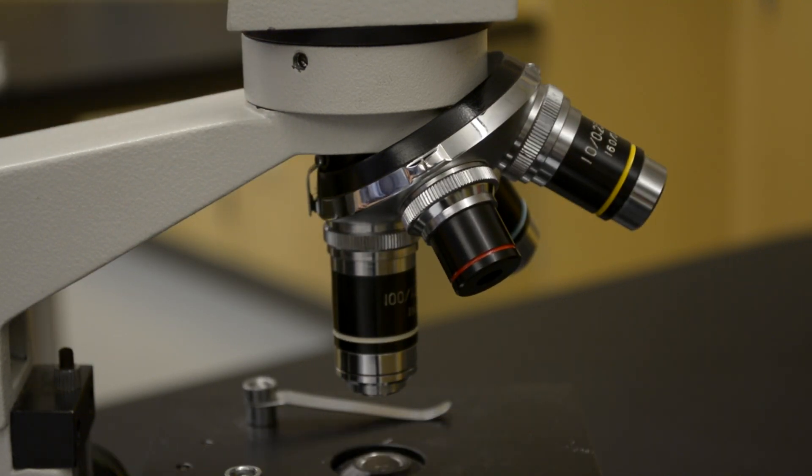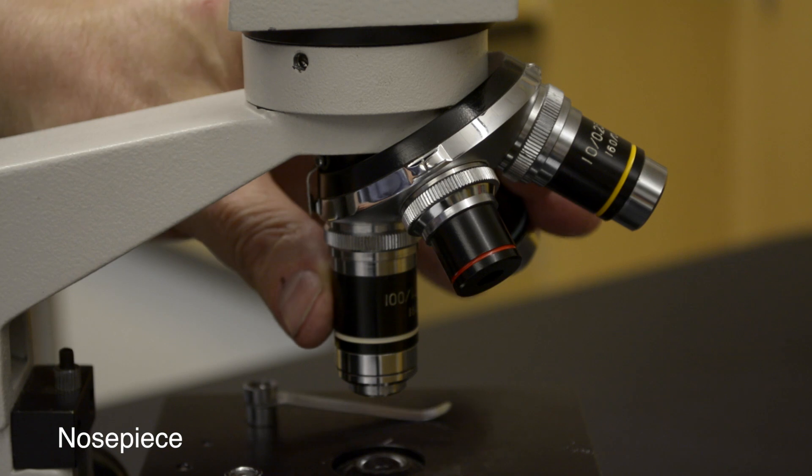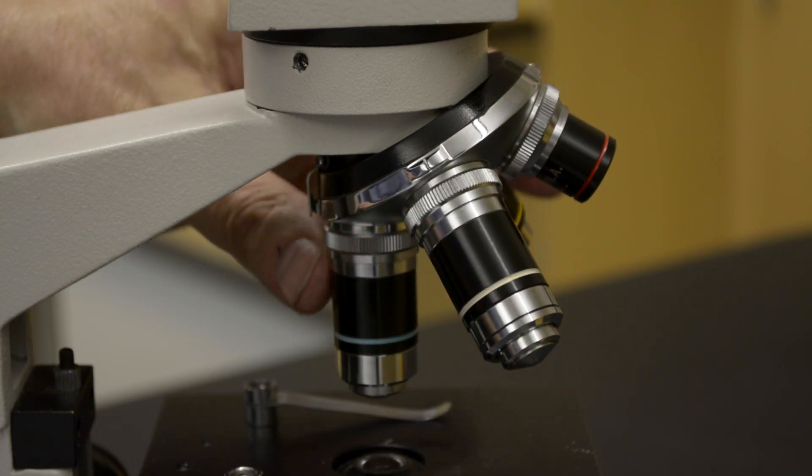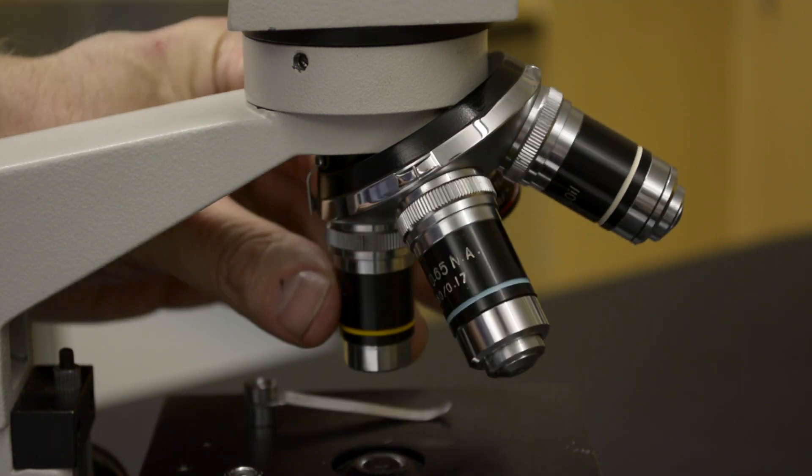These objectives are held in a revolving nosepiece. This allows you to swap from one objective to another.